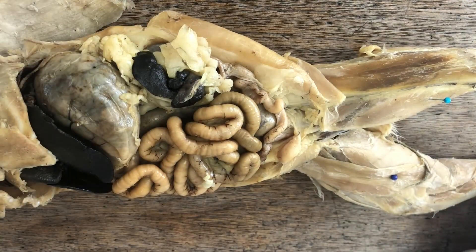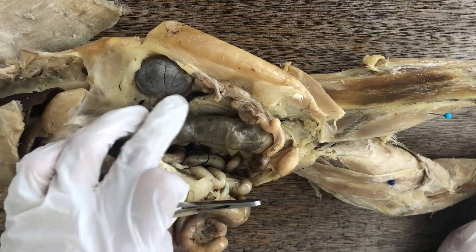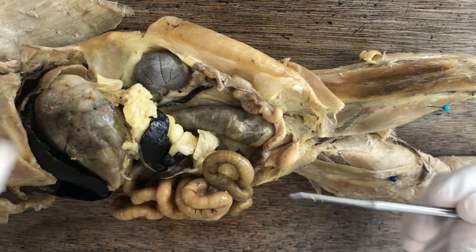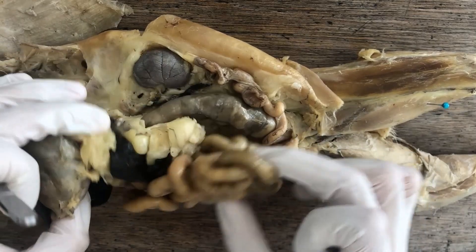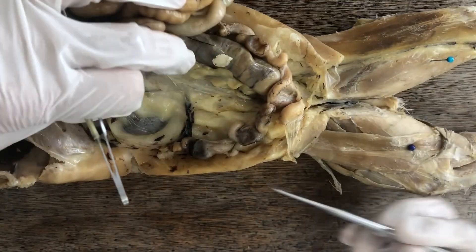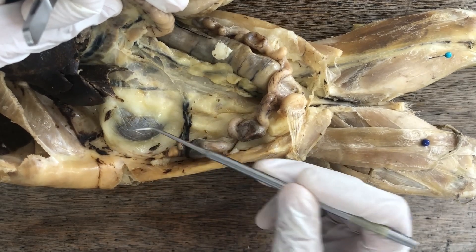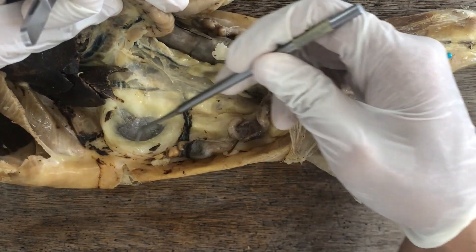One of the most important structures in the urogenital system would be these bean-shaped organs located on the back side of the abdominal cavity. This one is the left kidney. They're located on the dorsal abdominal body wall, and unlike other visceral organs in the abdominal cavity which are suspended by mesenteries and dangling into the cavity, the kidneys are not suspended inside the abdominal cavity.